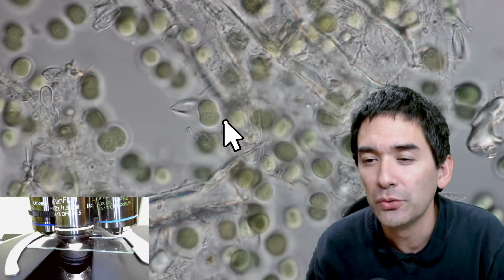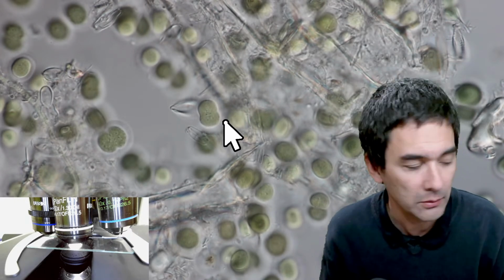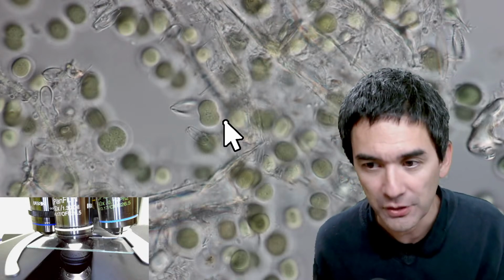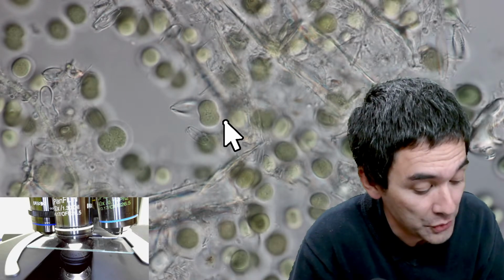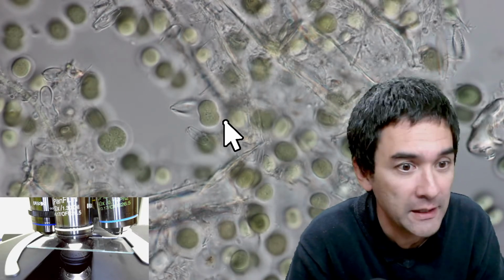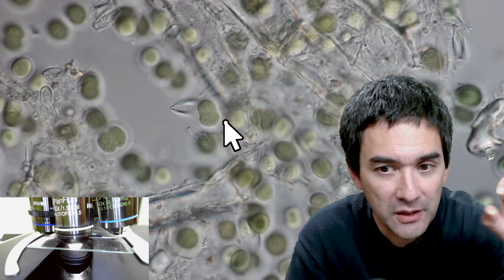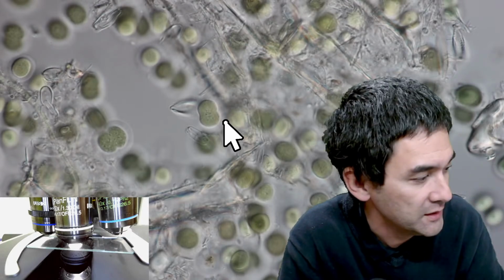Is it possible to use oil on a cover slip? Well, this is what I have done right now. I've now applied it, but I'm going to show you also later a heat fixed slide without a cover slip. This is also possible. It's actually the process that I've been using in microbiology. In the microbiology lab, I've rarely, I wouldn't say never, but I rarely used a cover glass, because I always used a heat fixed slide and also a gram stain slide, which were heat fixed. I'm going to show you what this is in a minute.